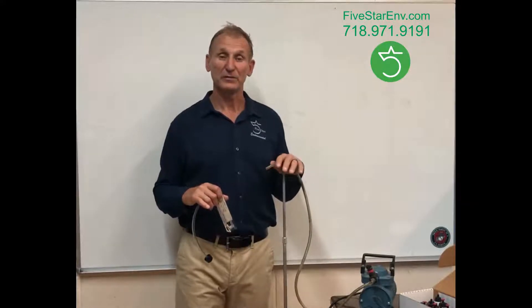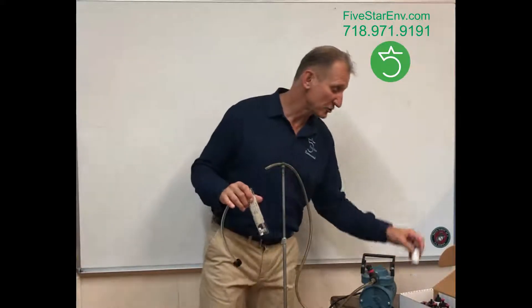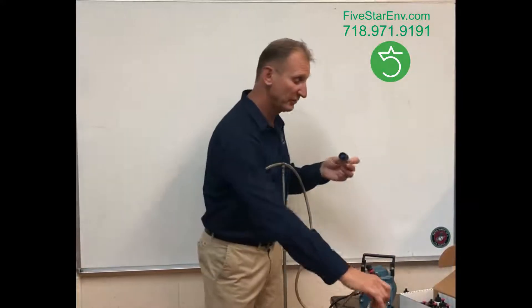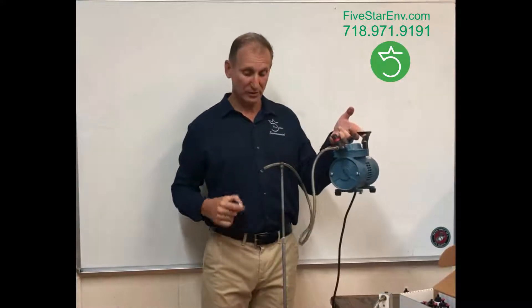For this purpose there is a very simple method called PCM air sampling. Here's a bunch of cassettes — this is actually a PCM cassette. It looks like this, a very simple device which is put on this pump hose. This pump will pull the air through the cassette, particles settle on the filter, and we can analyze it for asbestos — specifically for the fiber count.